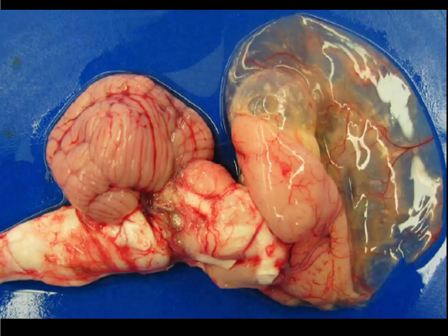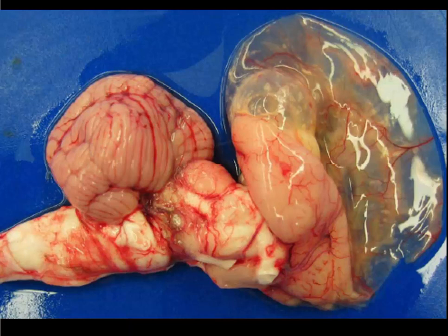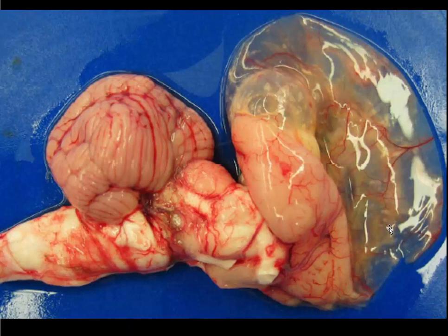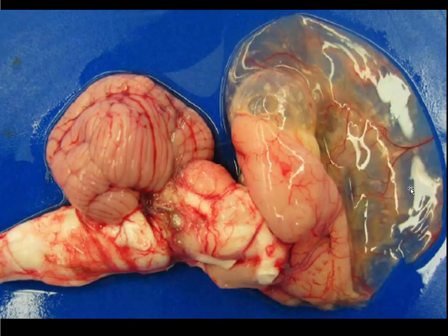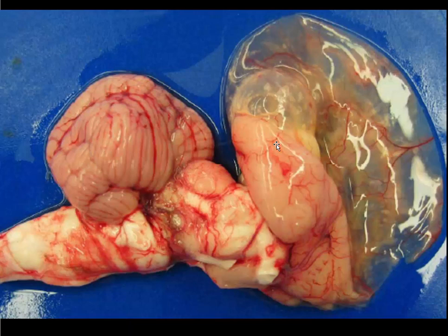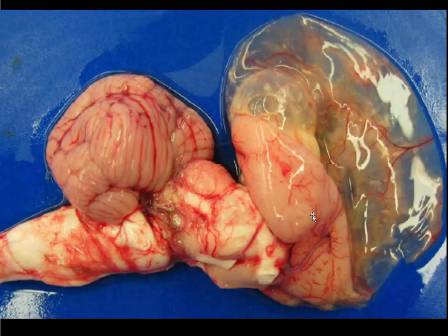Slide number four is a wonderful picture from Jim McLaughlin at University of California at Davis. This is tissue from a calf — give me a morphologic diagnosis and a cause. The morphologic diagnosis is hydranencephaly. The development of the cerebral hemispheres is almost totally interrupted. There's a thin shell which likely represents the leptomeninges. Notice it's the cerebral hemispheres — the deep parts of the brain, the thalamus, the basal ganglia, brain stem, and cerebellum are still present, though the cerebellum is a little small.